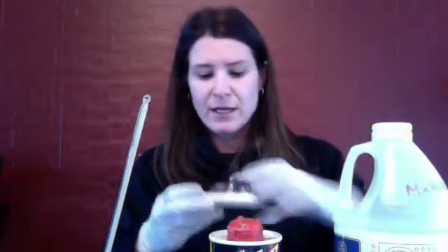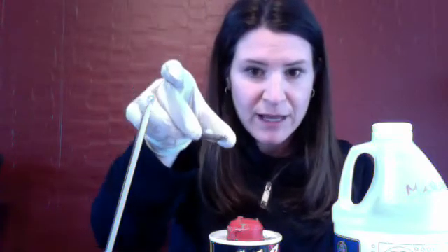In the lab it says we don't have a scale that is good enough to measure a half a teaspoon, but we do — it's right here. It's this little guy and it works awesome. What I did is I turned it on, hit tare weight, and then I measured a half a teaspoon of lye in this little pourable container. You're gonna want to write this number down: the mass of the lye is 3.615 grams.